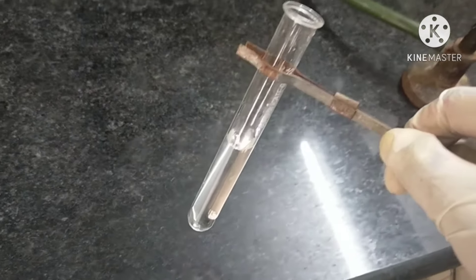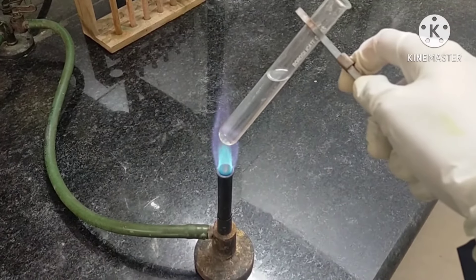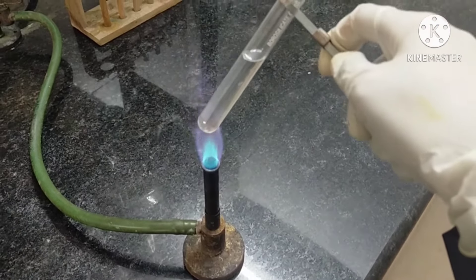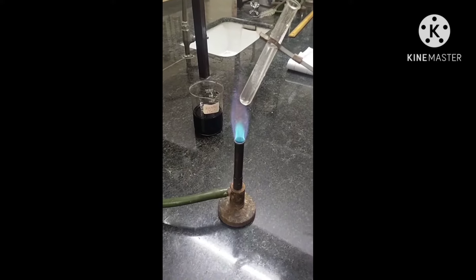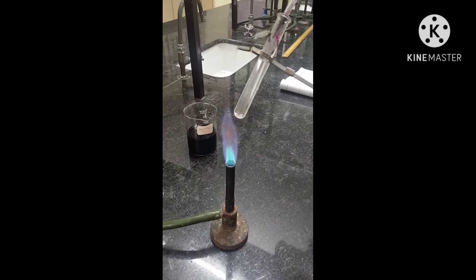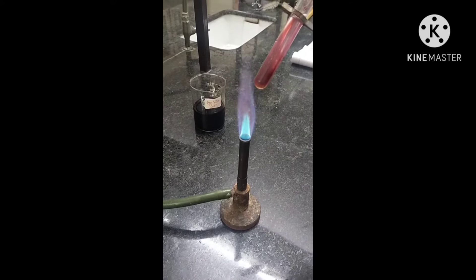We will heat this mixture over the burner. Now add the KMnO4 solution into this test tube with the help of a dropper like this. Observe whether the KMnO4 solution changes its colour — if it does, it means the oxidation of ethanol reaction has taken place.